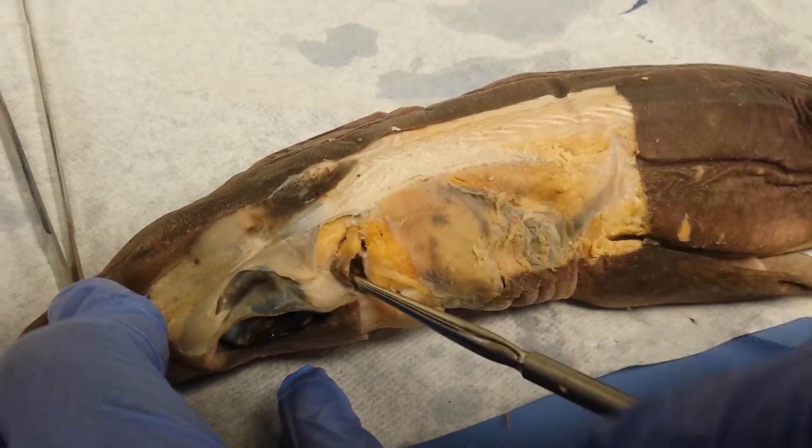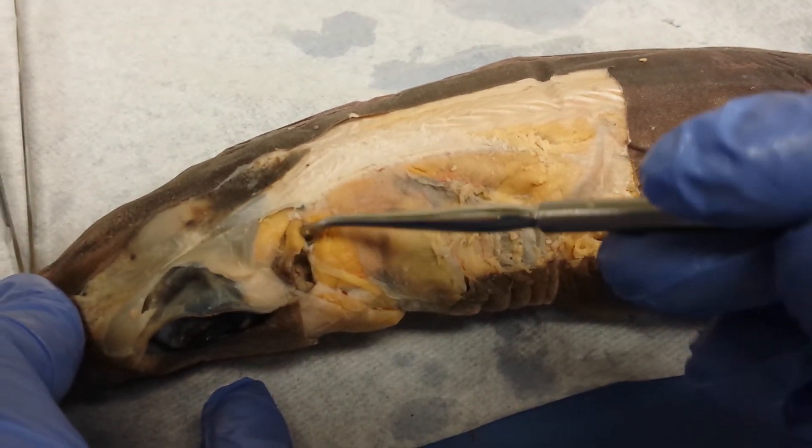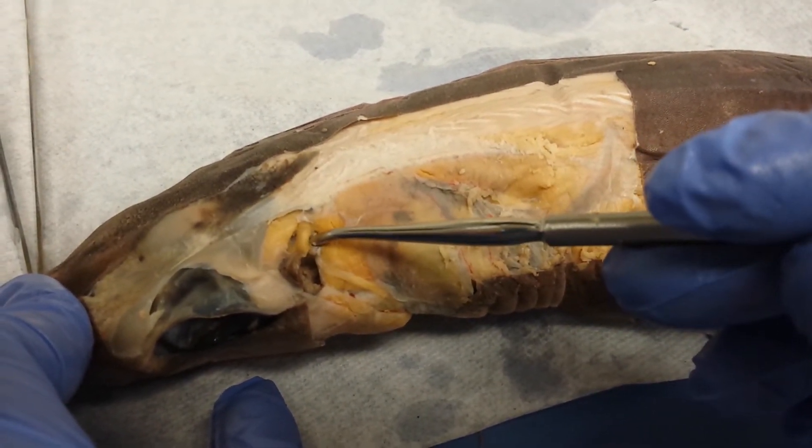Around the spiracul, which is this hole, I have this muscle that goes a U-turn all the way down and comes back. But I usually just see the top part. This is your spiracular.